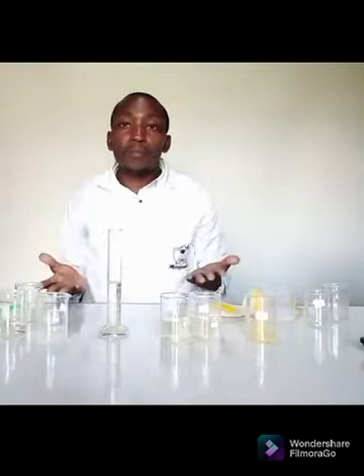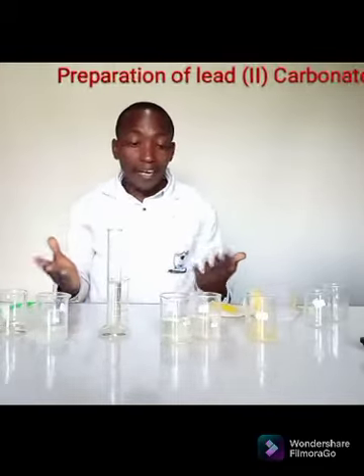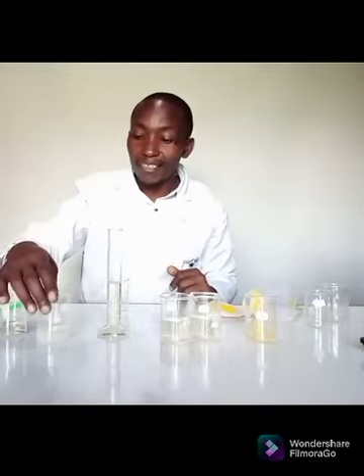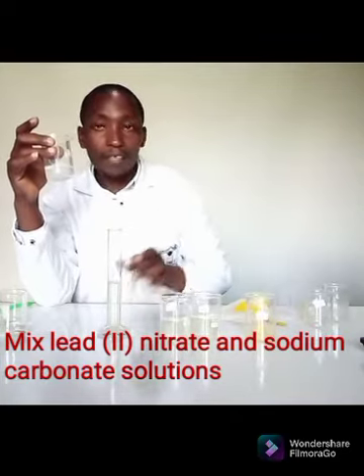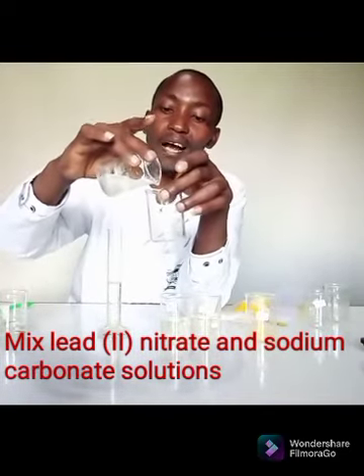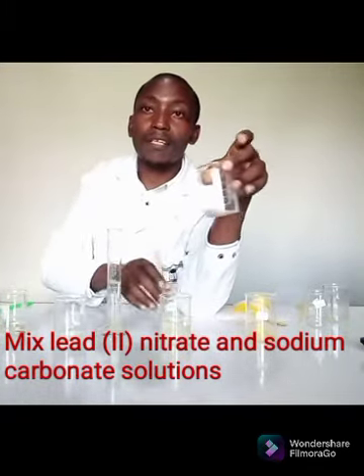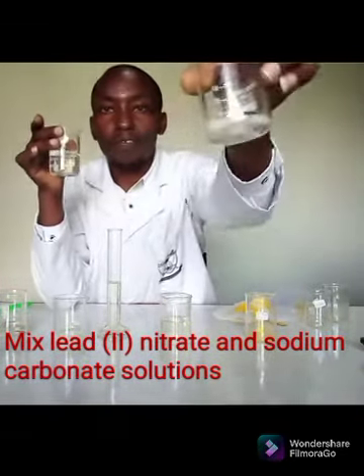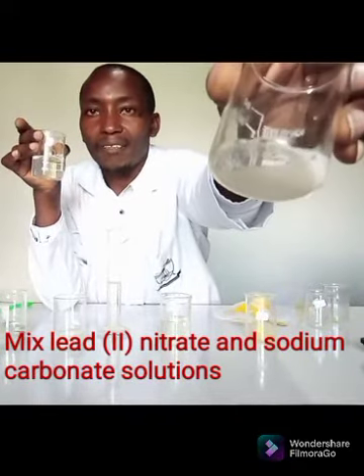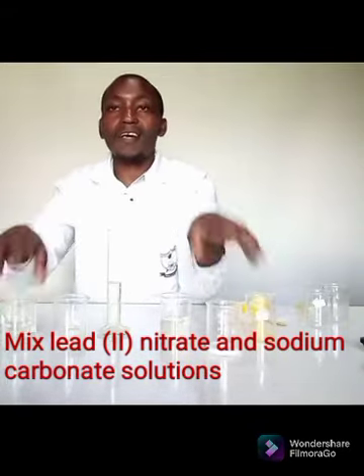If I intend to prepare any other type of salts, for instance, I can prepare lead II carbonate. As I started, I need to have a sample of the lead II nitrate. Then I have the sodium carbonate, and then I add. If you consider what has happened, a white precipitate has been formed. So the white precipitate is lead II carbonate.